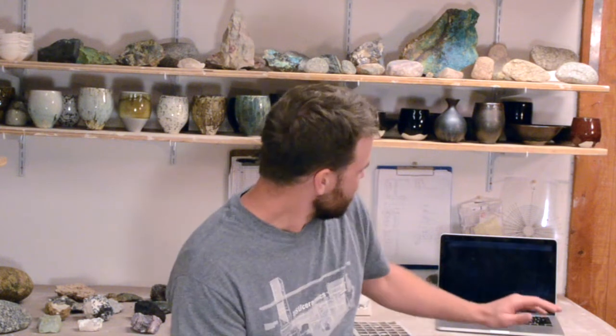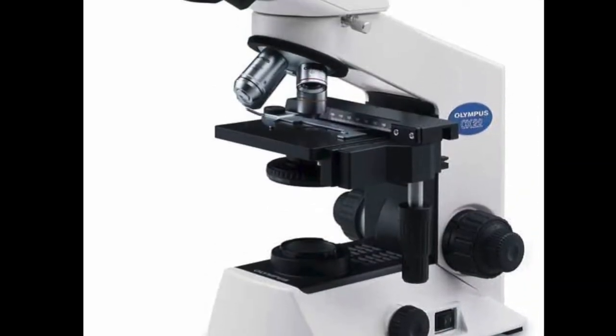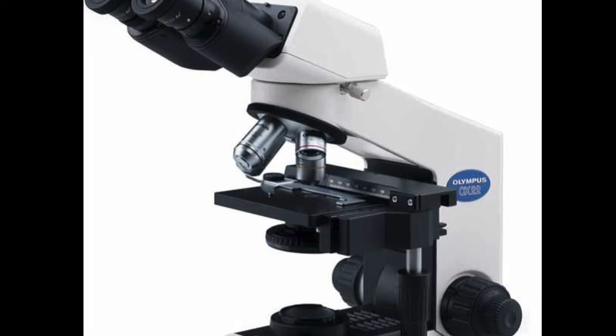And I want to show you some images that I took using a scanning electron microscope. For my first image, I think it would be useful to show you what's possible with a basic optical microscope. If you've ever taken a high school chemistry or science class, you're probably familiar with a microscope. The way they work is they reflect light onto a slide or a sample, and then you look through eyepieces and you see the sample, or whatever it is you're looking at.